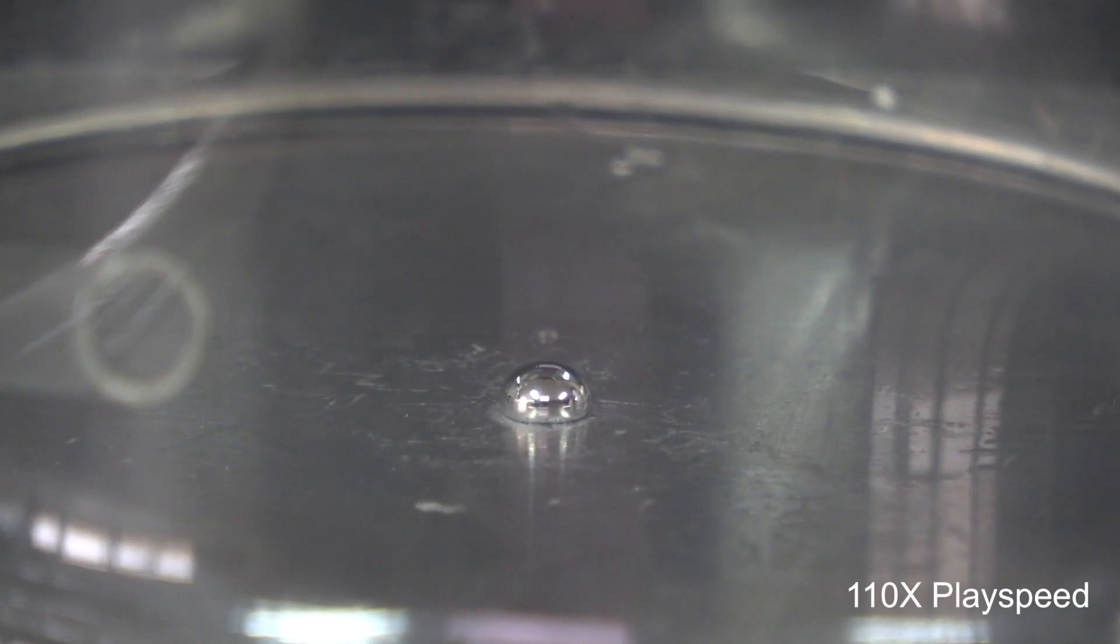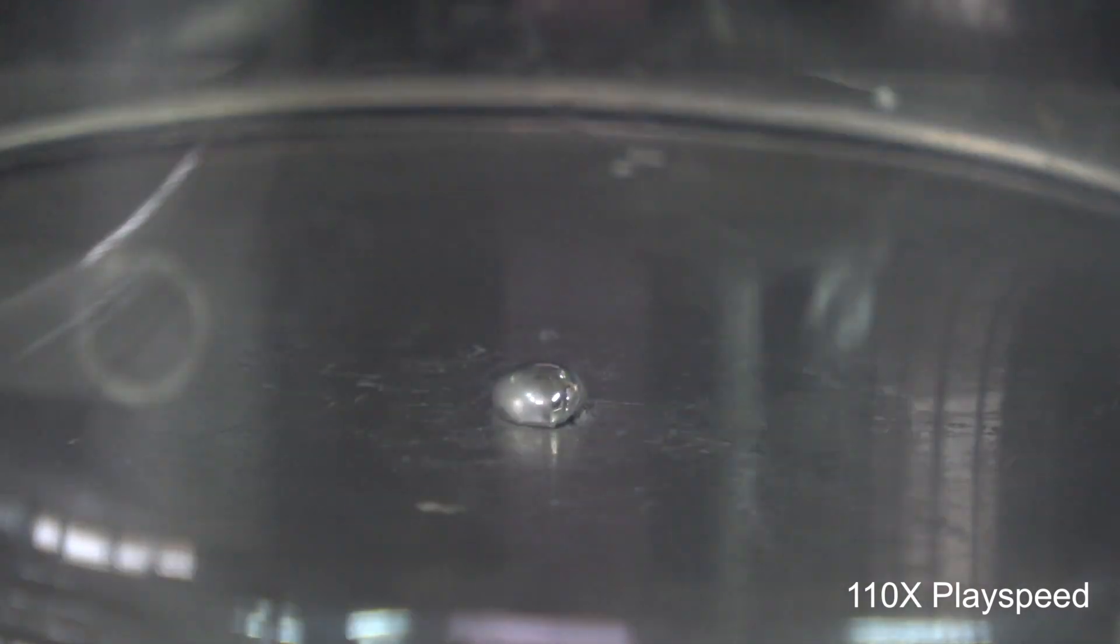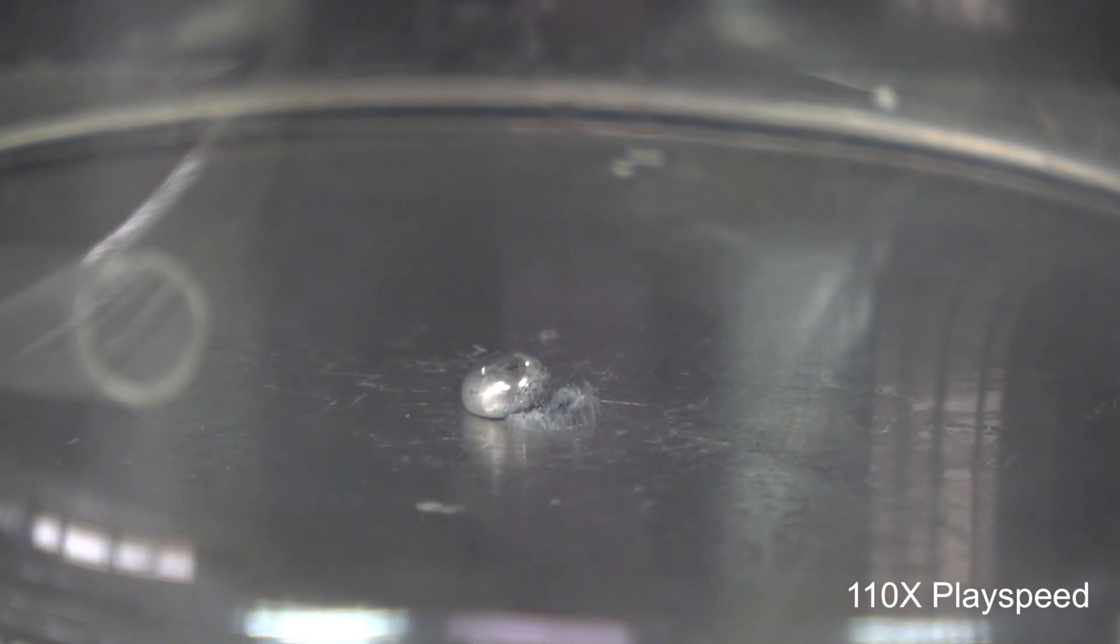Due to the high availability of oxygen, the surface of the mercury droplets is oxidized a lot quicker this time. Also, the fabrication of the amalgam took much less time to initiate, comparing to the one at atmospheric oxygen level.